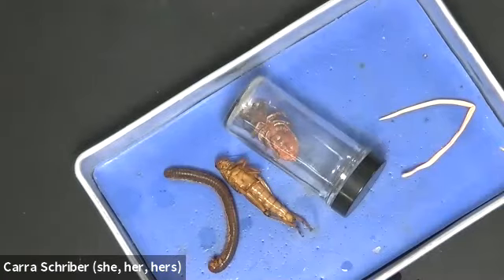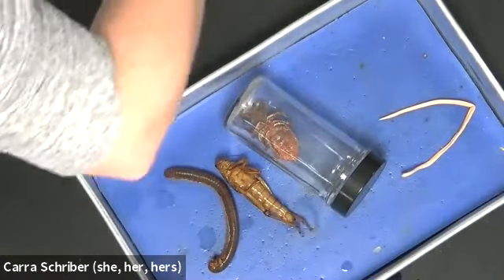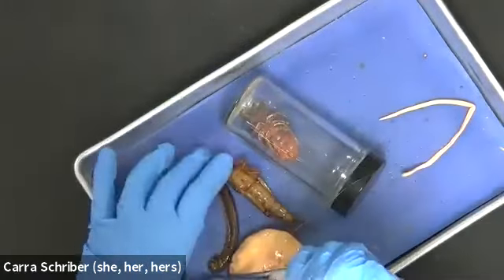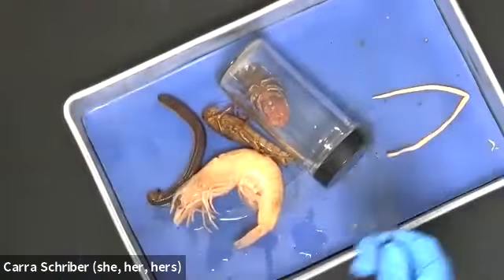Let's see if I can get this one out. Okay, I got it. And then we've got this shrimp.